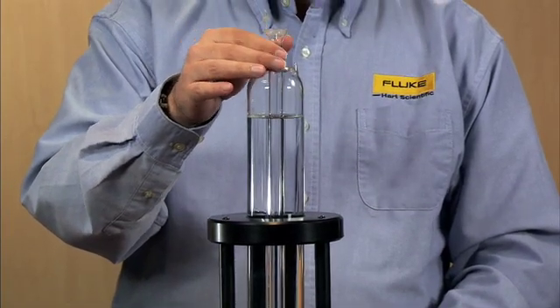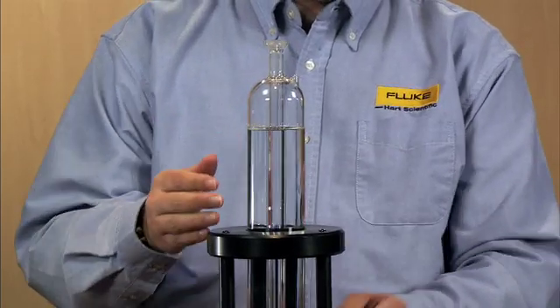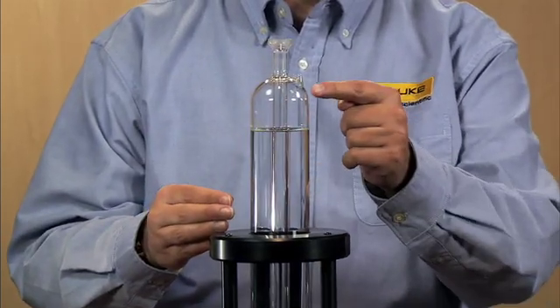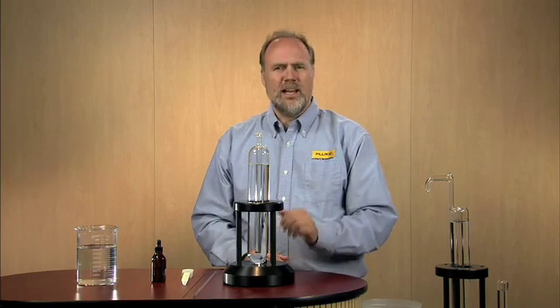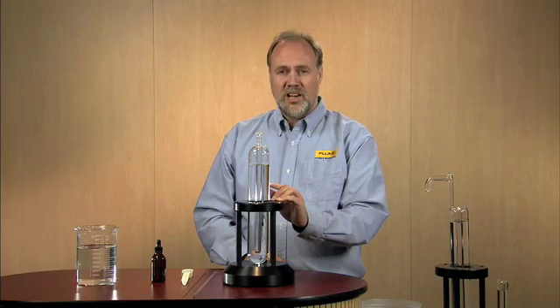I'm calling it a triple point of water. What we're seeing right now is water as a liquid and water as a gas or a vapor. Obviously, to make a triple point, we'll have to introduce the third phase of water, solid.